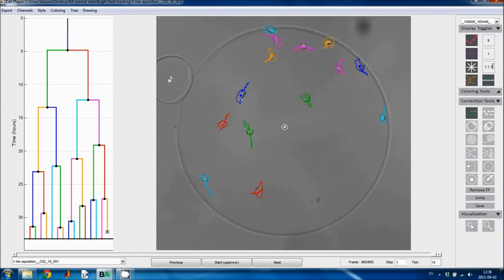This is an RGB triplet with values between 0 and 1. So 1 1 1 means that we have maximum intensity of all three colors. If we set it to 0 0 0, we have no intensity in any of the colors and we get black. We get red by setting the first element to 1. If we set the second element to 1, we will get a mixture between red and green, and that's yellow. But usually you will go for either black or white, depending on what is most visible with the given background.